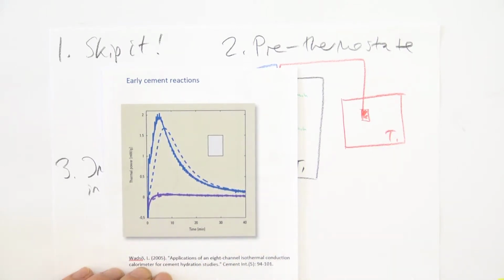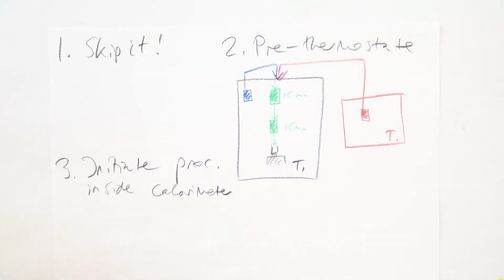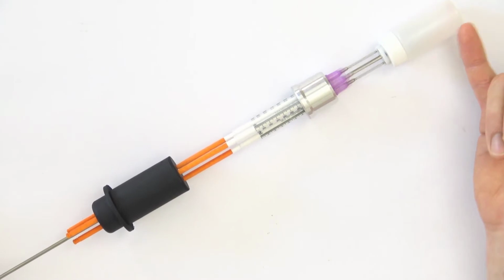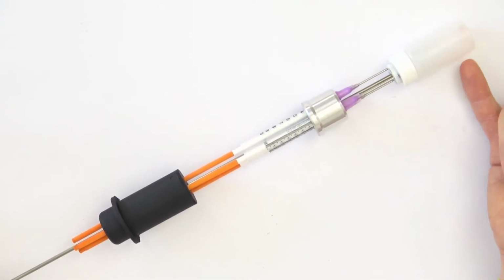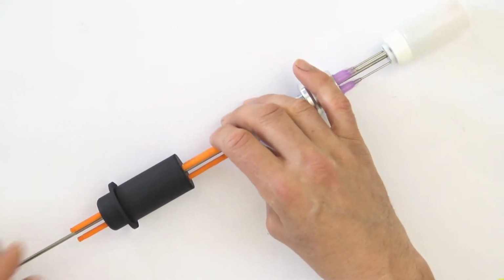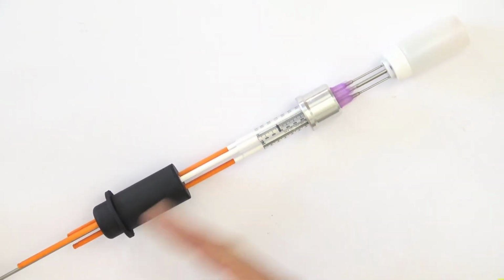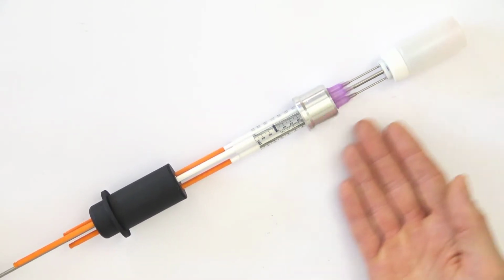Now this has been done in another way. Now here the cement and water has been mixed inside the calorimeter, and to do that you need special equipment, and I will show an example of how such an equipment can look like. So here we have the vial. So we put the vial in, with cement in this case in the vial, and here we have syringes. So we charge one of the syringes like that with some water, and then we place this in the calorimeter to equilibrate so that it will reach a constant temperature.